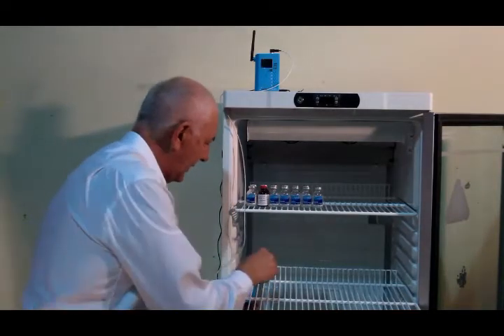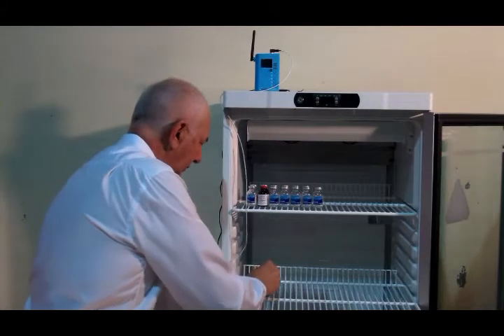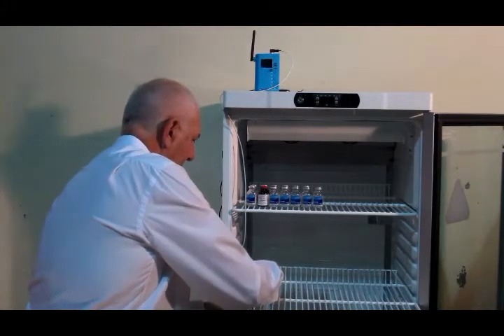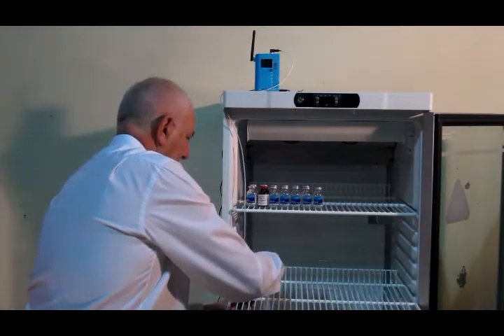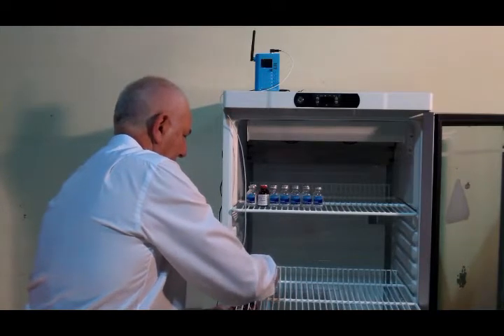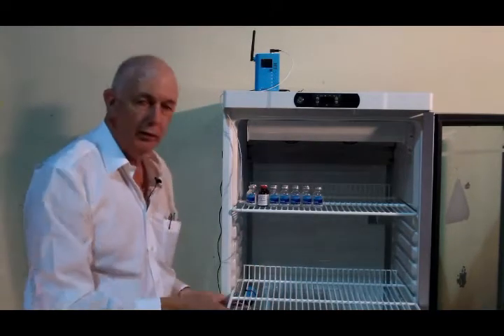Place the sensor under the vaccine fridge shelf and cable tie it in position. Not right at the back of the fridge, not right at the front, just centrally.